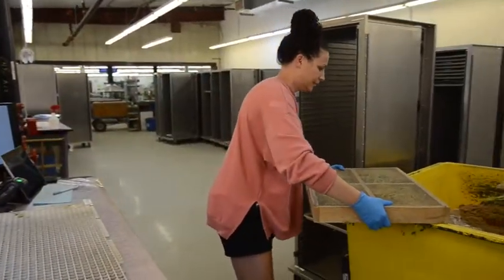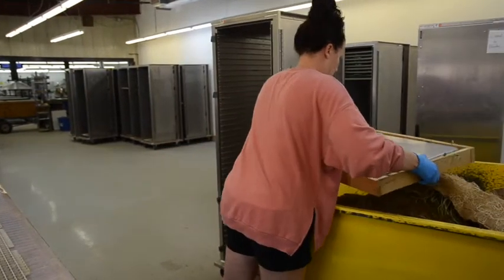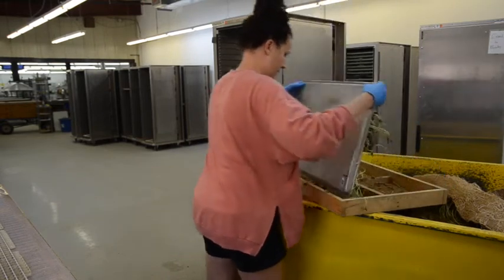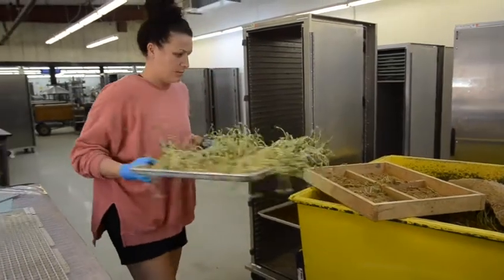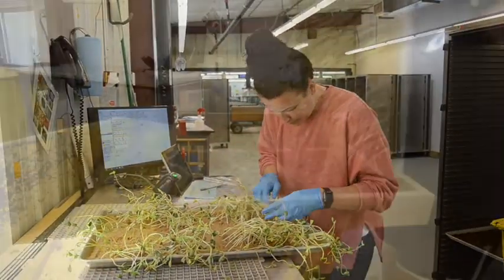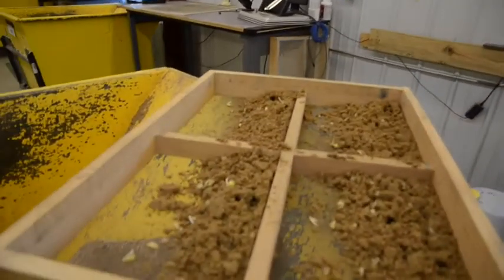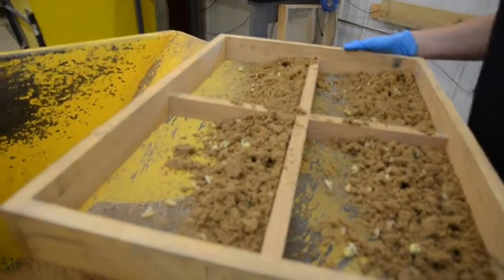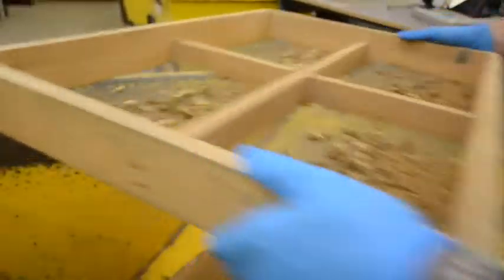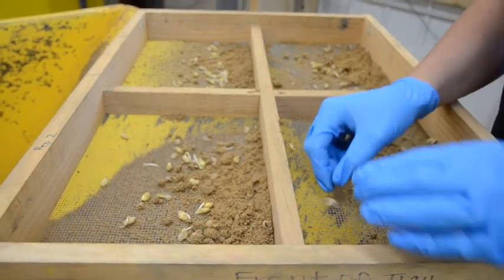At the point of extension we go back through the sample and evaluate any additional emerged normals. We also use this screen to remove the sand and count any normal seedlings that are remaining under the sand that have not emerged. Here we're examining the sample for any of those smaller normal seedlings that have emerged, screening off the sand and looking at each quadrant for additional normal seedlings.